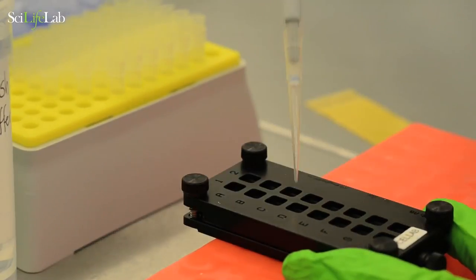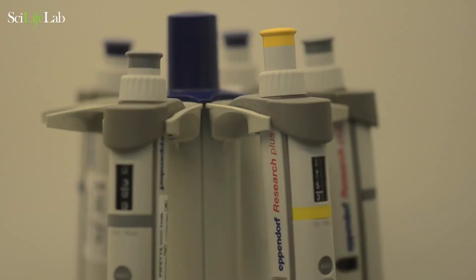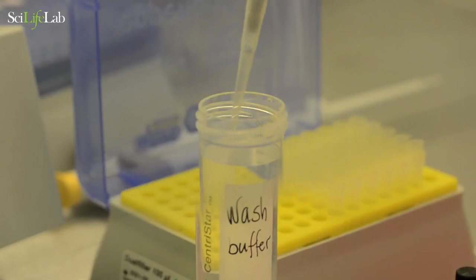Carefully remove the collagenase from all wells. Wash by pipetting wash buffer onto and off the well.